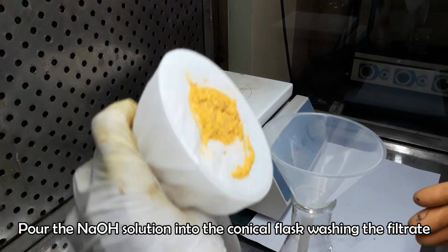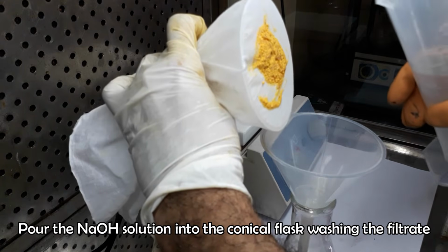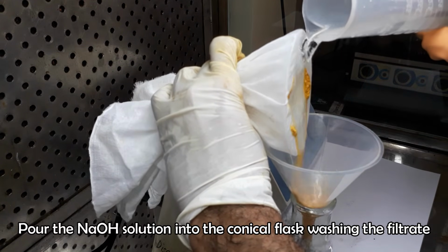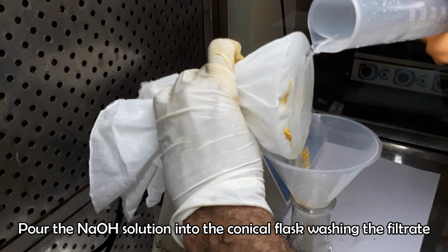Now take 200 milliliters of 0.313 molar sodium hydroxide solution and pour into the washed conical flask, washing the filtrate into the flask.